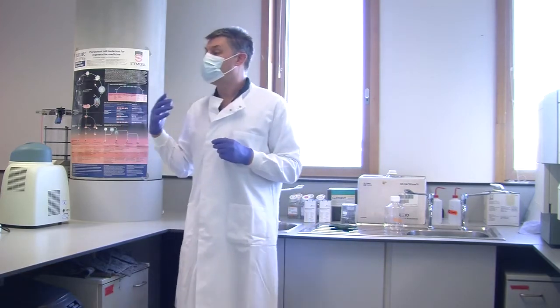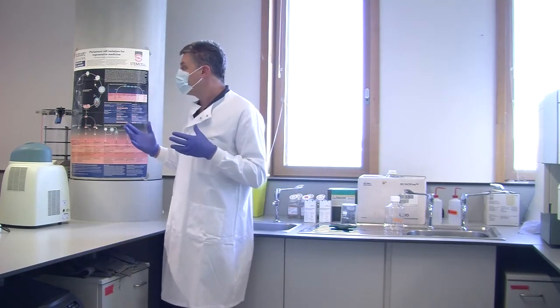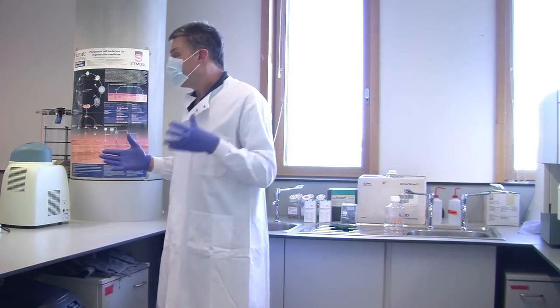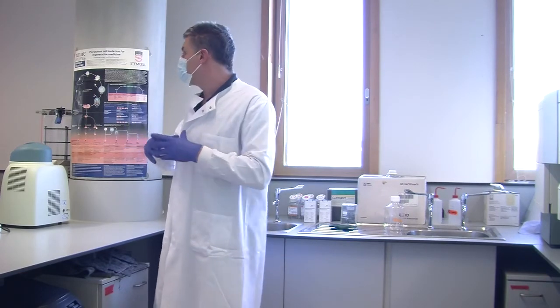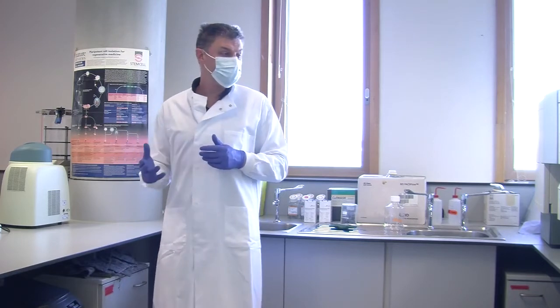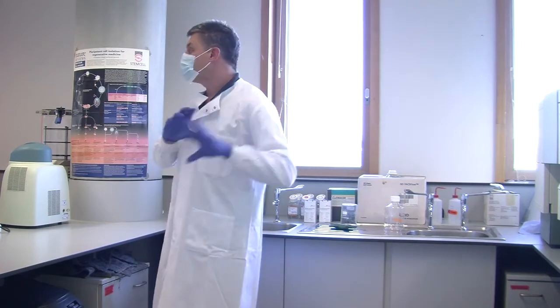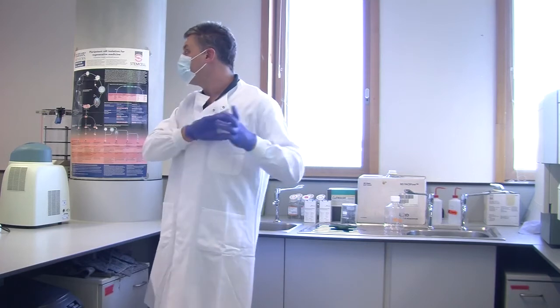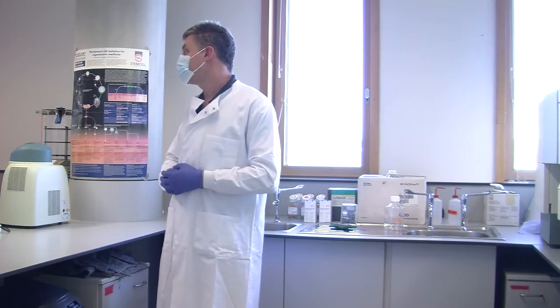And so, obviously, given all this complexity, it's quite a challenge for you to learn all of this in a couple of hours and then analyse the data in a couple of hours. So I will send through a handout detailing some of the basics of flow cytometry for you after today. And I will also go through in the two half-hour incubations just how we actually look at our data and what the plots mean and what the scales mean and so on and so forth. Okay?